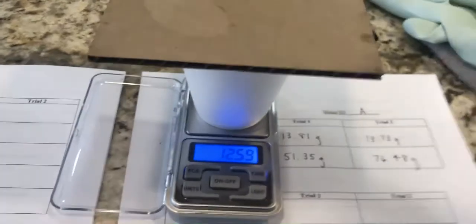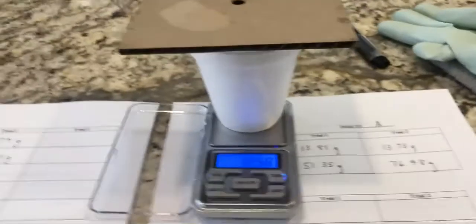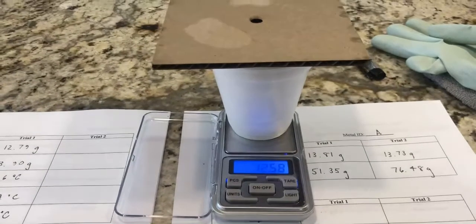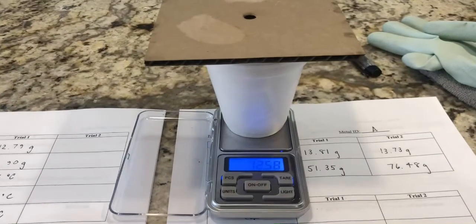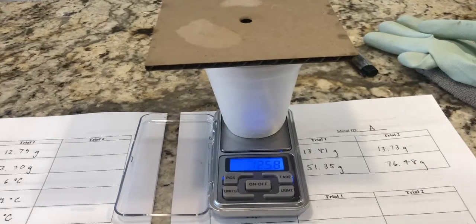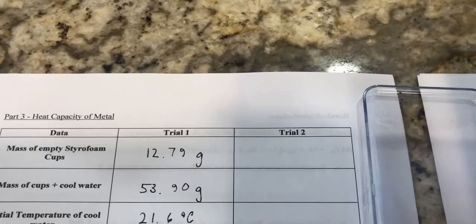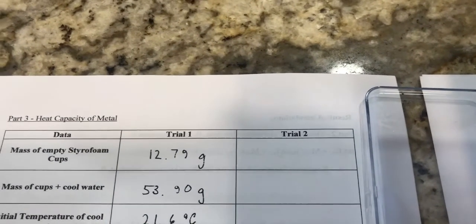I've emptied out the calorimeter and dried it and now I'm getting my mass of calorimeter, which is two styrofoam cups with a lid — and strangely it's not the same number I just had. Same system but now it's 12.58 grams. So when I record my initial mass of empty styrofoam cups with lid it's going to be different. Isn't that weird?